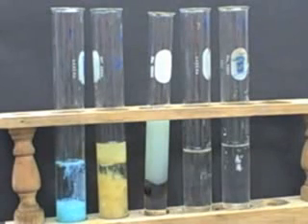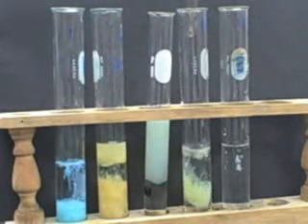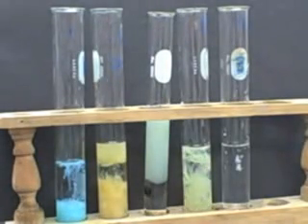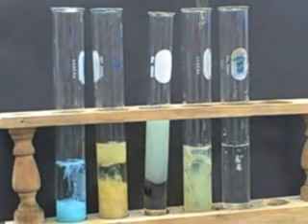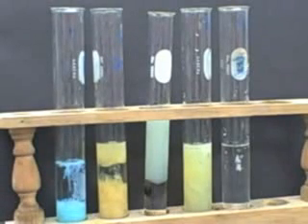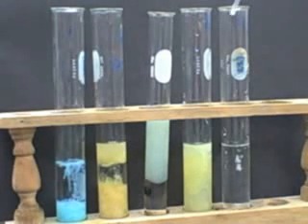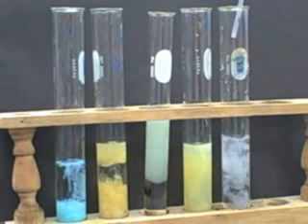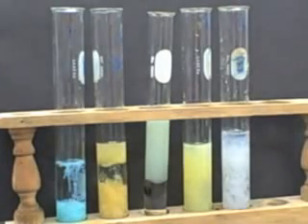And then silver. This is silver nitrate and sodium phosphate. Nice yellow color on the silver phosphate there. That's great, actually. That's not what I expected to happen. Thought it was going to be whitish. Wow, that's great. And now let's see if lead does a similar thing. This is lead nitrate and sodium phosphate. Just a whitish blue precipitate there. So those are phosphates.